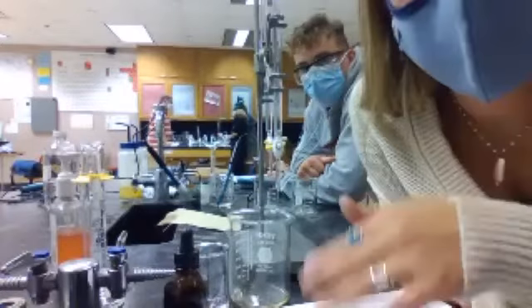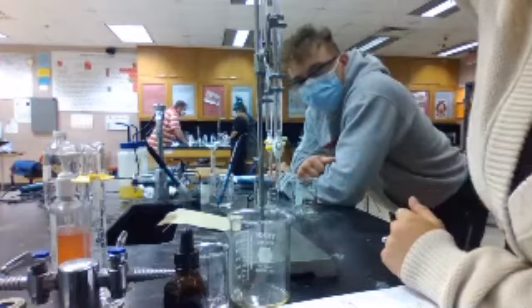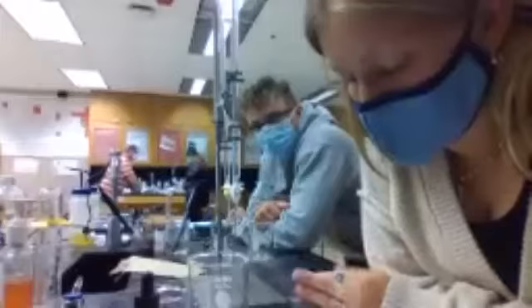Wait, how did we get more? Because we're draining more. To make it drop, I have to go this way. It goes from 0 all the way at the top, and then this is 10, and then this is 20. Oh, okay. So you know which way you're going, right? Thank you, Adam. So this one should be a better trial than before, because we now went up.